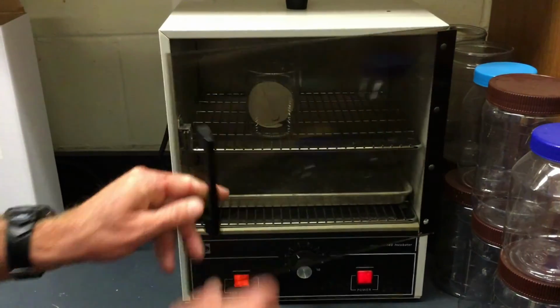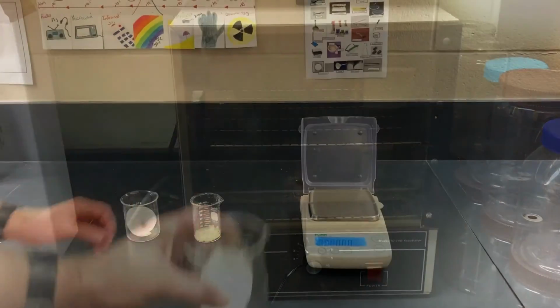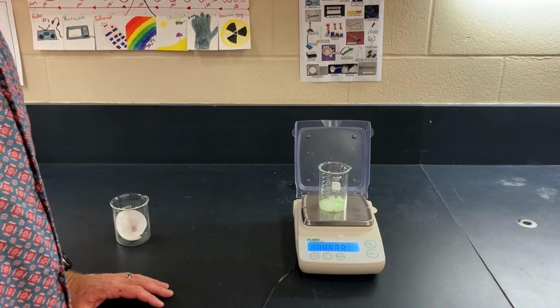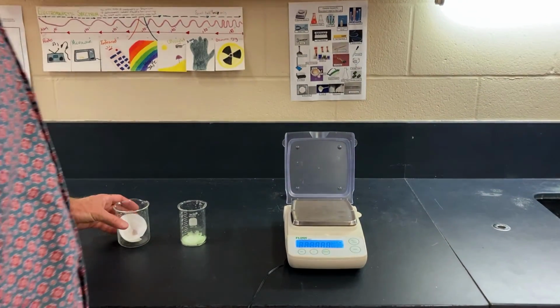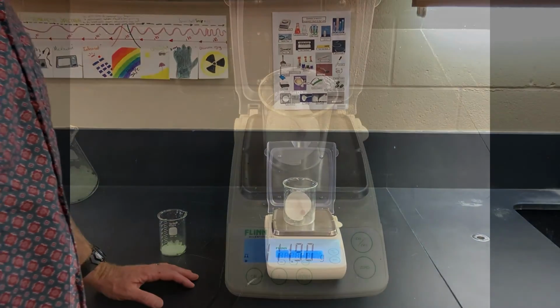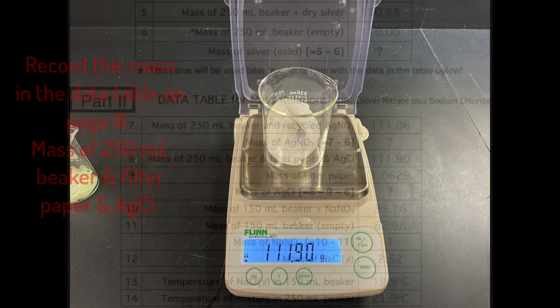The next day, we can take our beaker out of the oven. The filter paper and solid should now be dry, and we can obtain the mass of both the sodium nitrate and the silver chloride. Record this mass in the data table at the bottom of page 6 as the mass of the 150 milliliter beaker plus NaNO3. Record this mass in the data table at the bottom of page 6 as the mass of the 250 milliliter beaker and filter paper and AgCl.